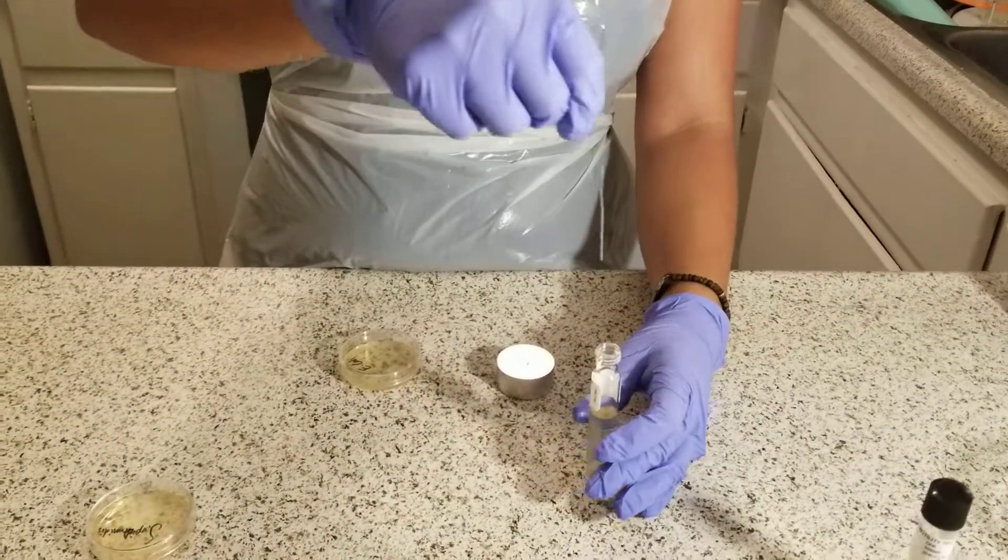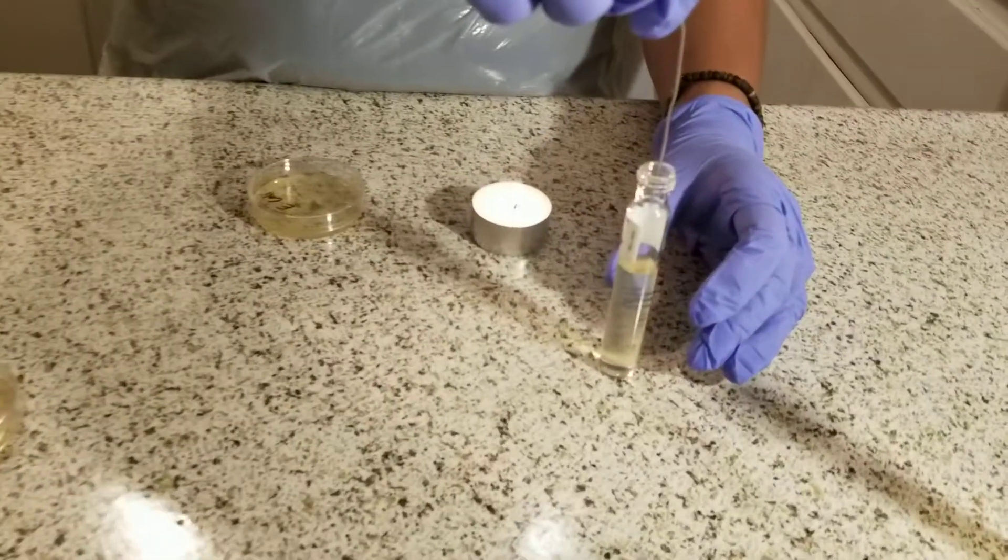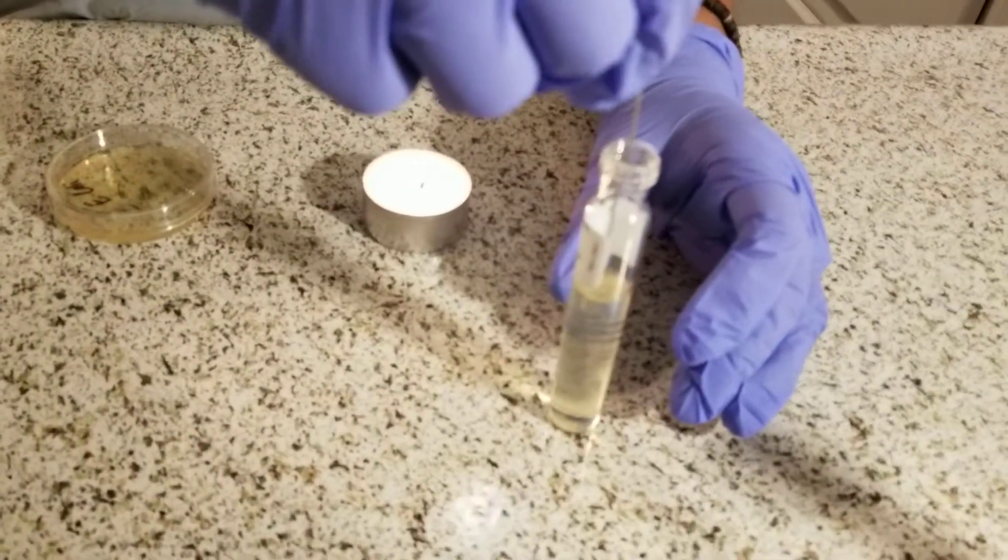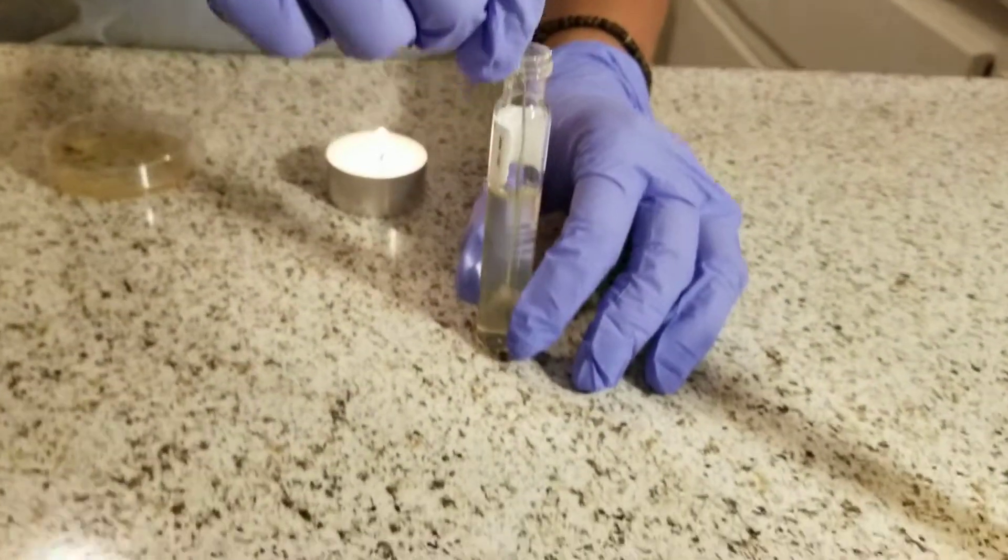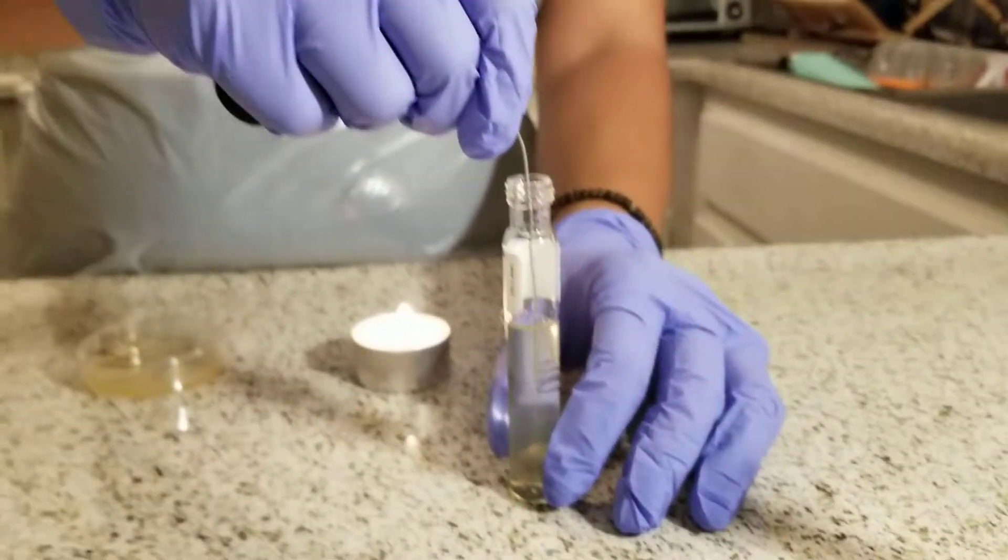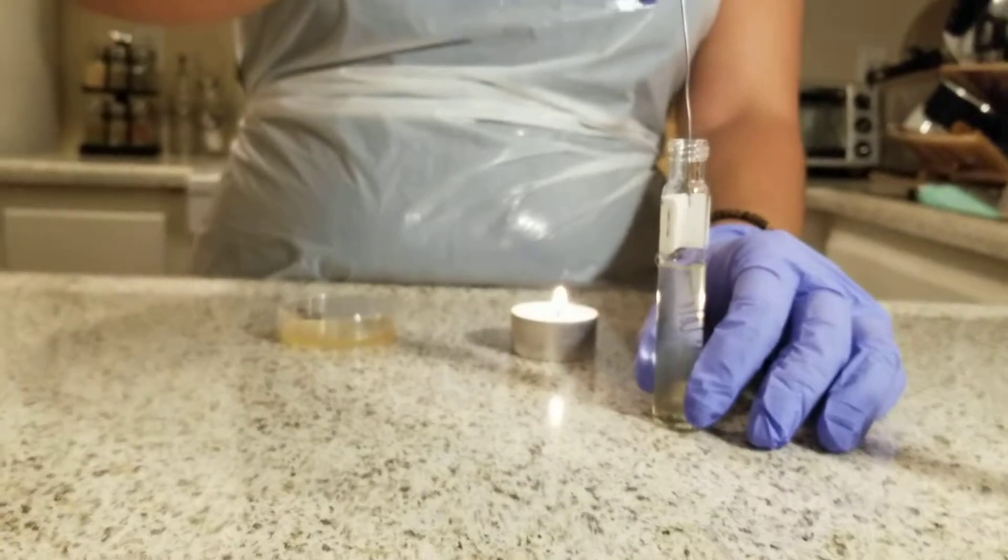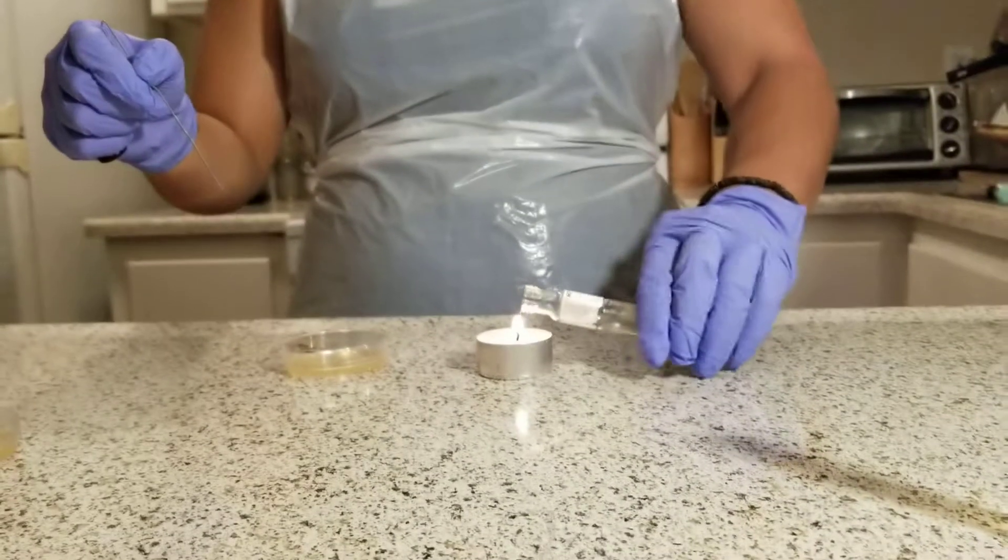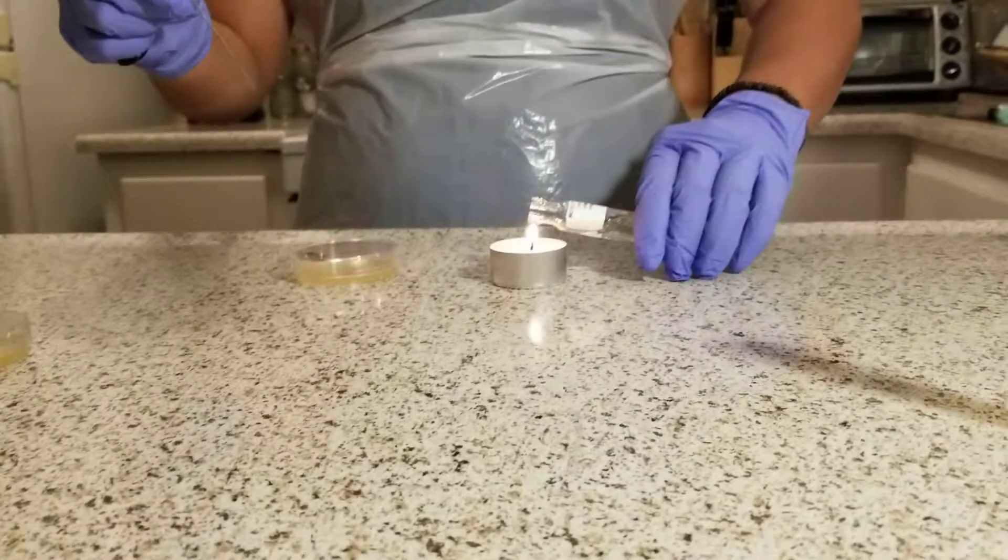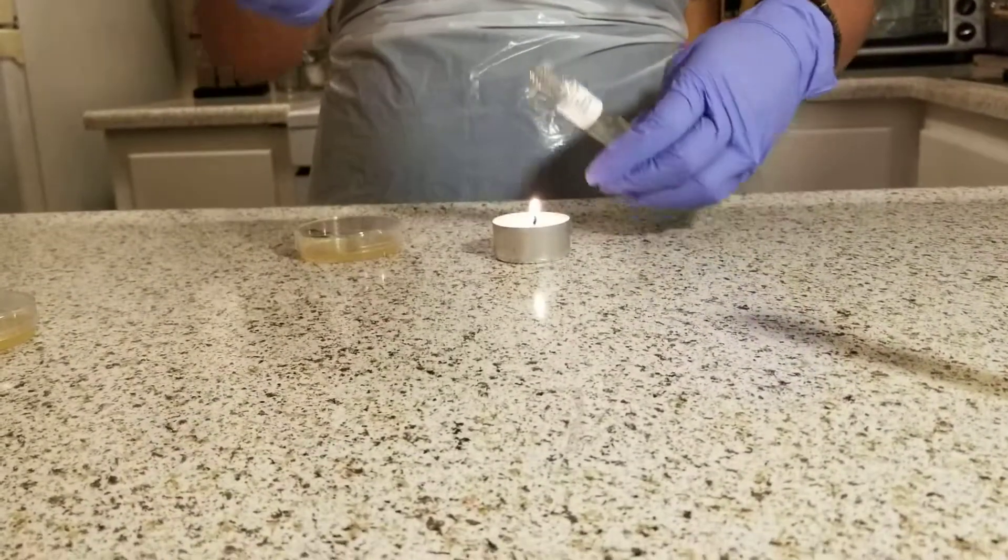Then I stick my paper clip straight into the agar, keeping the same motion. I remove my paper clip, then reheat the lid for sterilizing and close it.